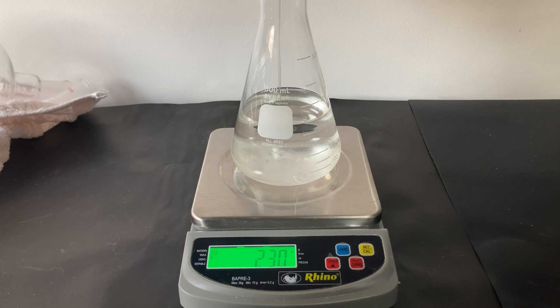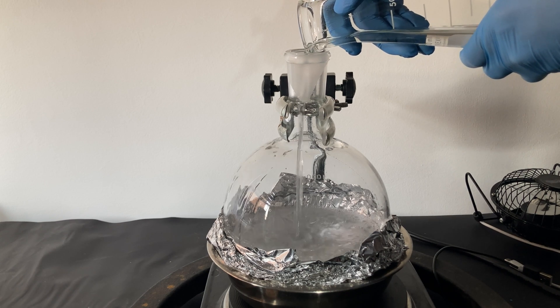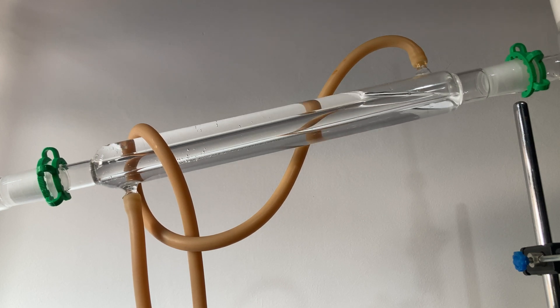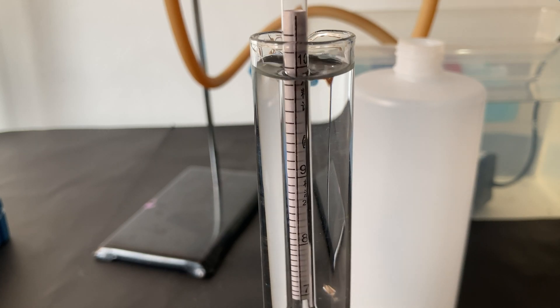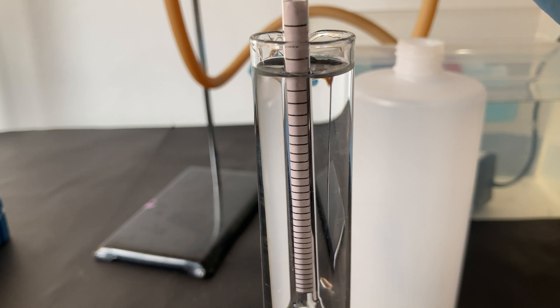Also, bear in mind that as the distillation goes on, the ethanol-water-glycerin ratio may change and the azeotrope could reappear. In my case, I'm not sure if that's what happened, or if my fractional column was not long enough, or if water from the air affected the final result. But sadly, I was not able to obtain pure ethanol in my first run. However, I got 99% ethanol, which is great! This proved that glycerin can indeed prevent the azeotrope from forming.